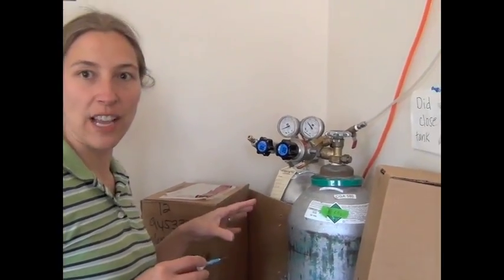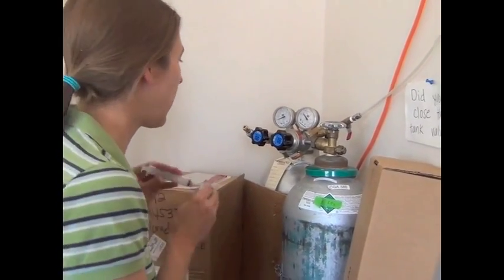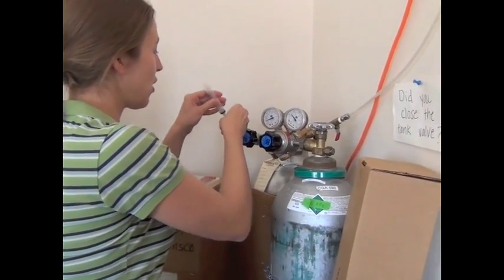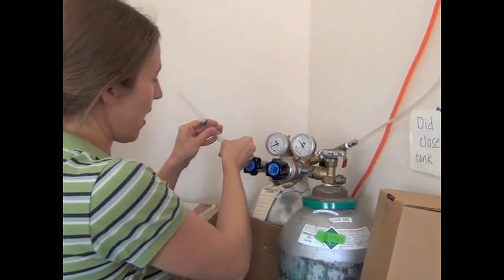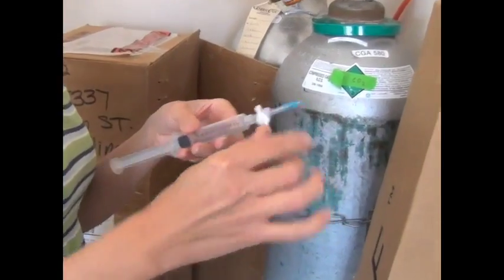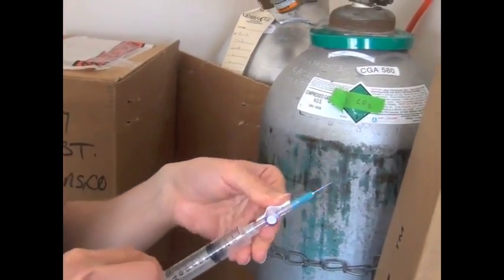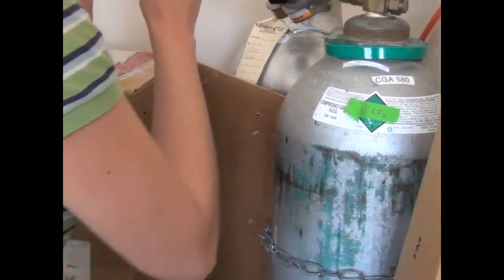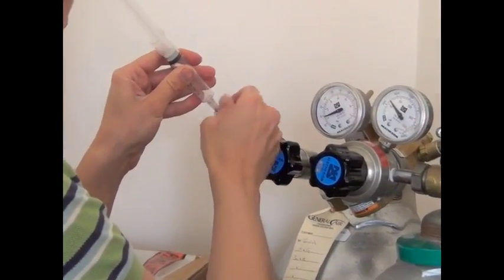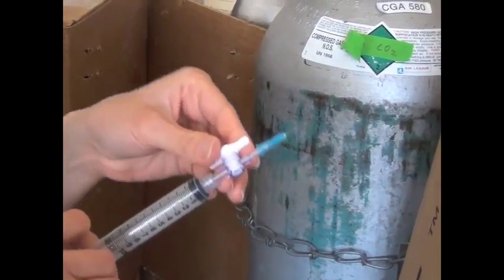So this is our standard tank gas. It's 1,040 ppm of CO2. Before taking my actual sample, I need to flush the syringe with tank air. The reason is that on this syringe, this area right here is a dead space that has whatever air was in there on the previous use. So I always flush my syringe with the standard tank air twice to flush out that head space, so that all of the air in this head space is now from the tank.